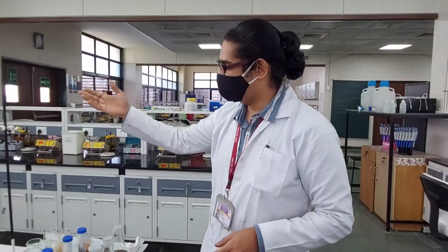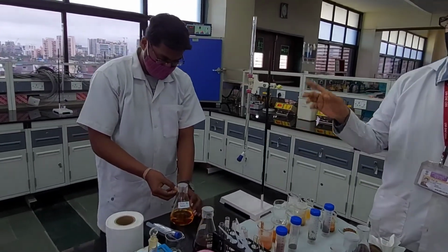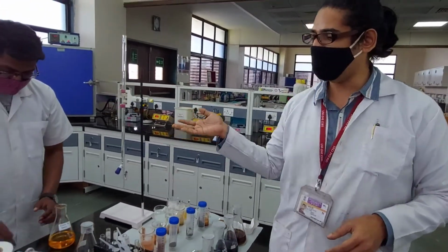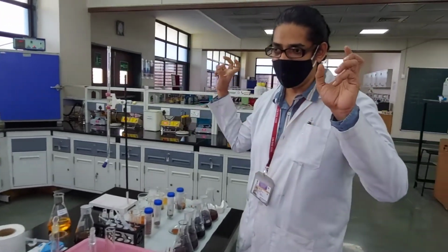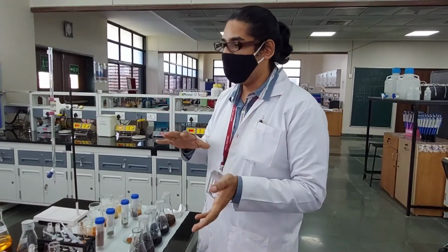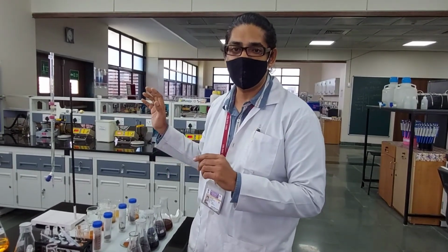So, we are going to titrate it against ferrous sulfate. Now, this is the blank, as it doesn't have any soil, no carbon content, so it should actually have all the dichromate available for the titration. So it should in principle show us the highest value. Now, whatever soil we use, if organic matter is consumed, you will be left with a lesser amount of dichromate. So when you titrate, if everything goes right, let's see whether things are right or not.